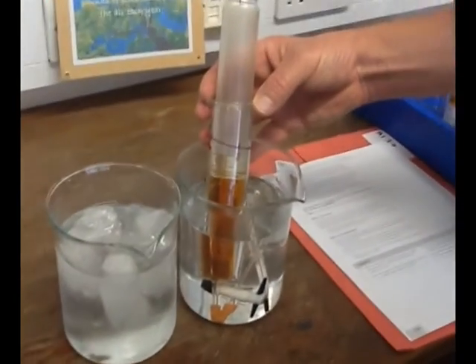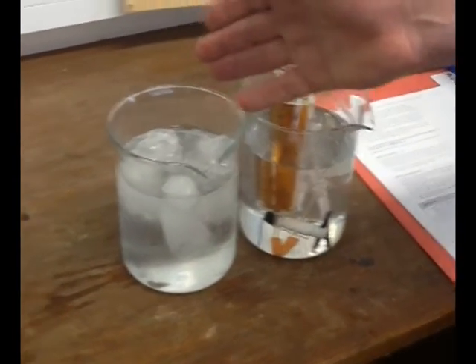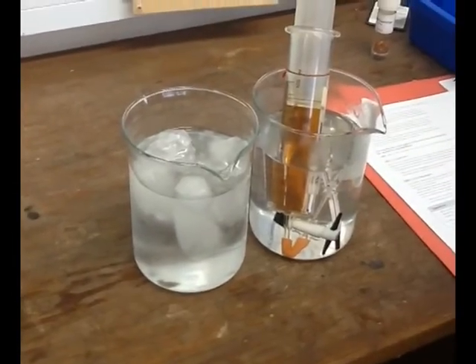Okay, so effect of temperature on equilibrium then. So in this one we've got more NO2 being formed and in the cold environment we have more N2O4 being formed. So what we need to do is work out what's going on in terms of the equilibrium position.